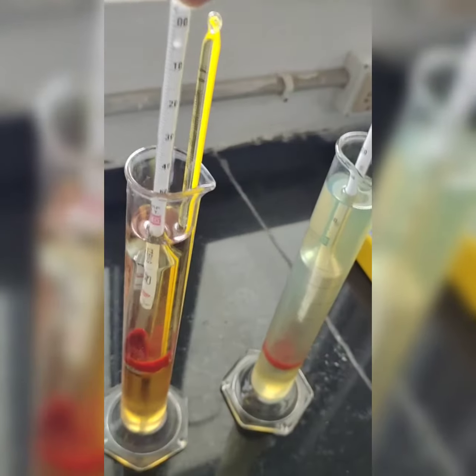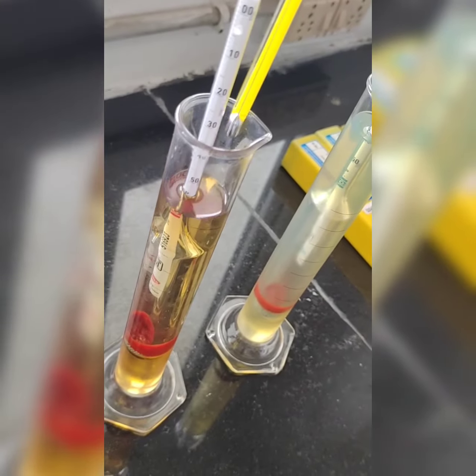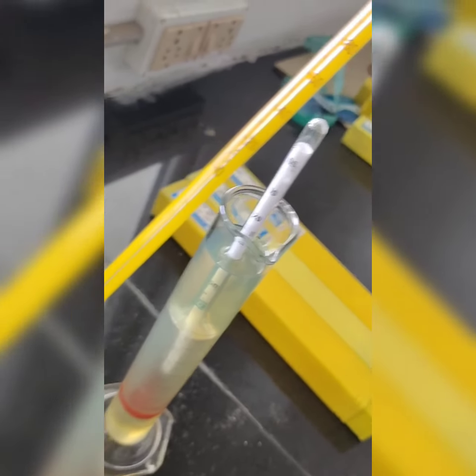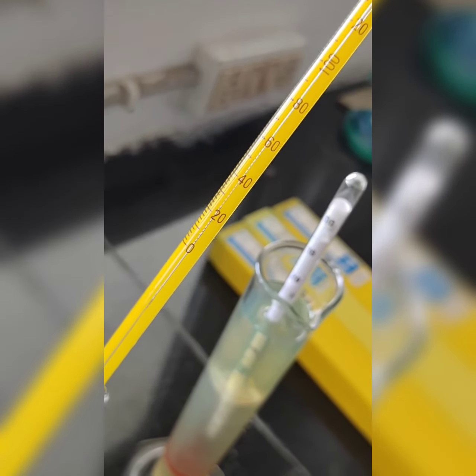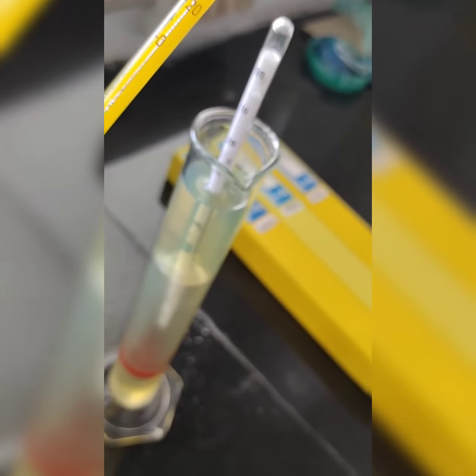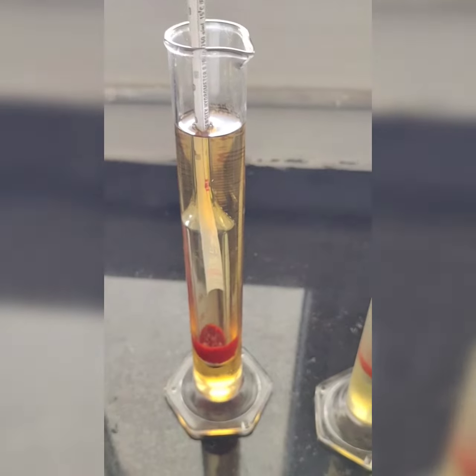And for this, if you see the temperature, let's check the temperature now. So you can check the temperature here. It is lying around 20 degrees. Okay, then let's put it in another one. Whatever the temperature, you can do the calculations later, you can change it.